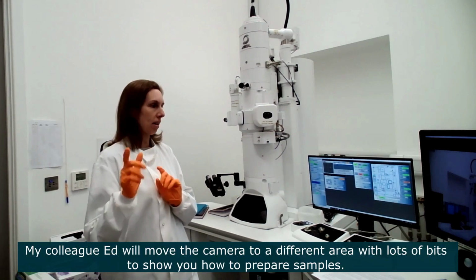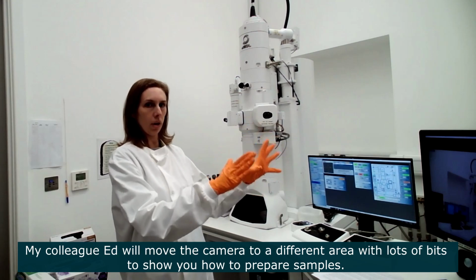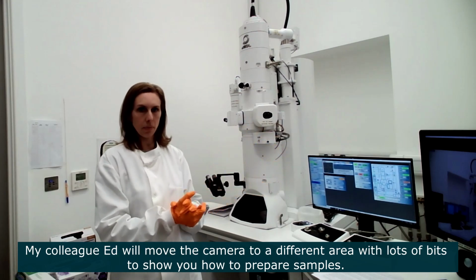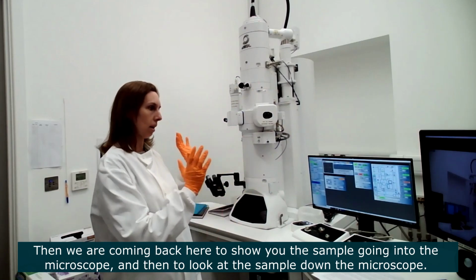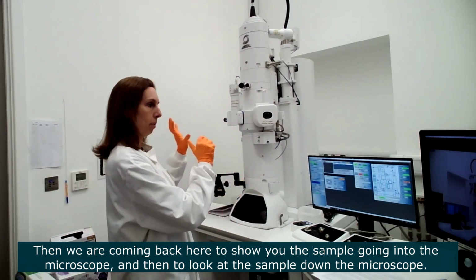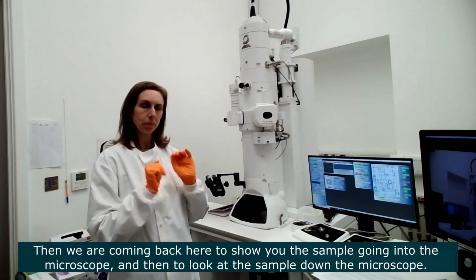So my colleague Ed here will move the camera to a different position where we have an area with lots of bits to show you how to prepare samples. And then we're going to go back here, and we'll be repositioning the camera again to show you once the sample goes inside the microscope, and looking at the sample down the microscope, okay?